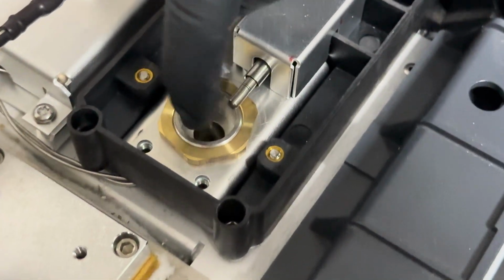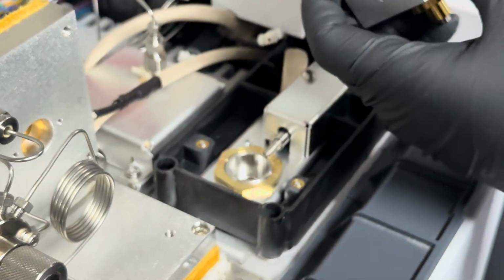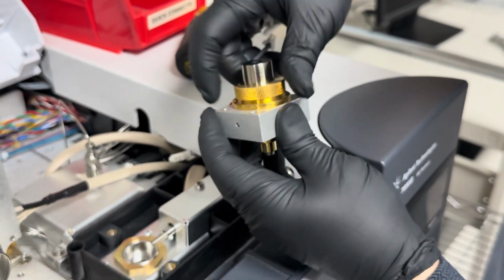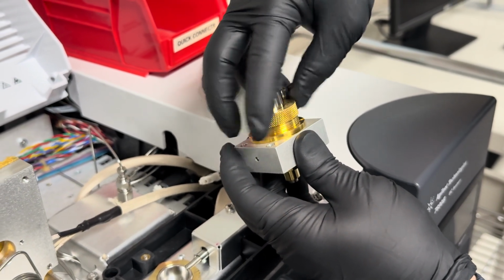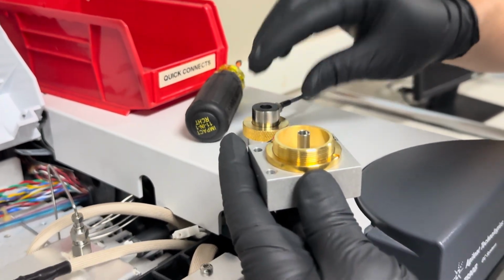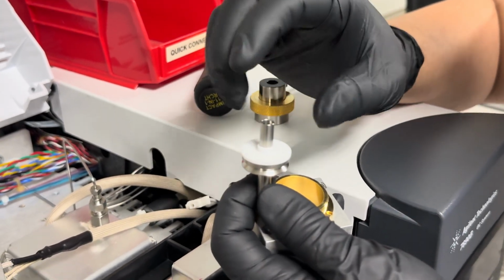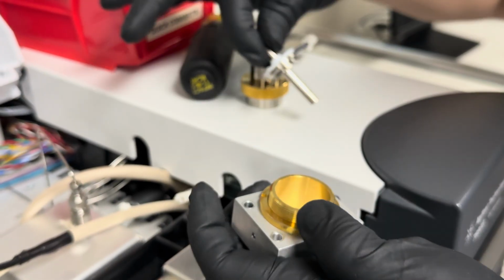And just make sure all this is nice and clean. If you need to clean it out, that would be a good area to clean. And then this, you disassemble it by turning the knurled knob. You remove that part. You'll have to make sure all that's clean. Then you got the collector with the insulator, the top insulator. And make sure all this is nice and clean as well.